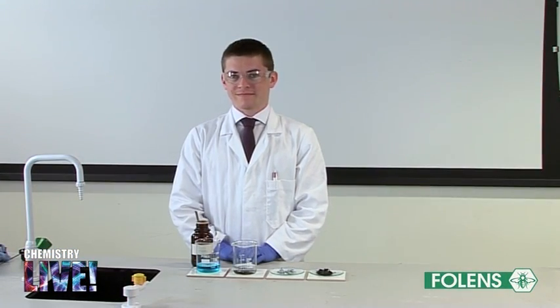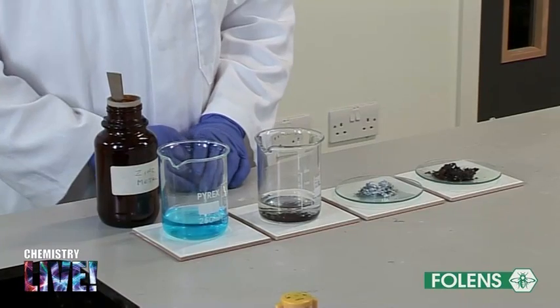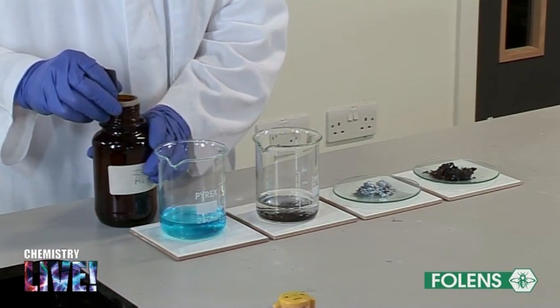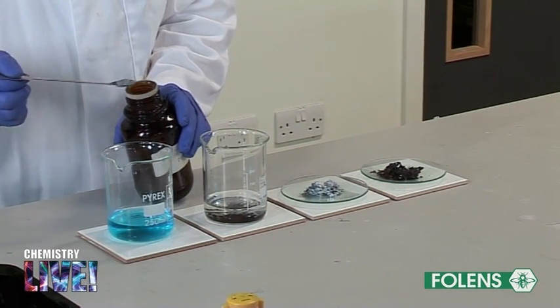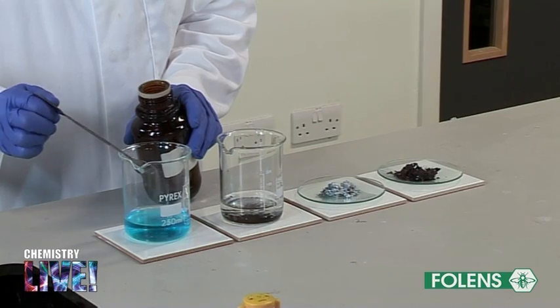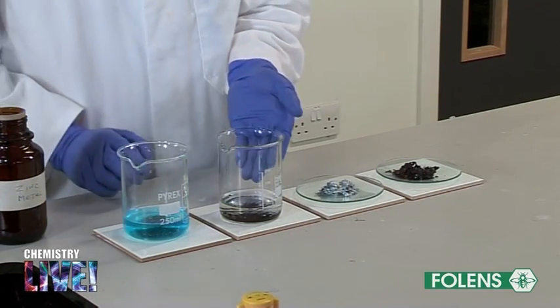Oxidation-reduction reactions also occur between one metal and another. For example, a piece of zinc metal dipped into copper sulfate solution displaces Cu2+ ions as copper metal. This may be shown by adding some powdered zinc to copper sulfate solution and leaving it to stand for a few hours. We observe that copper metal is deposited in the beaker and that the blue color of the copper ions has disappeared.